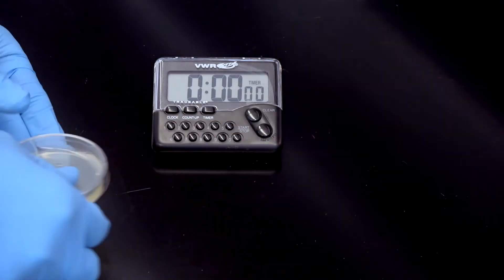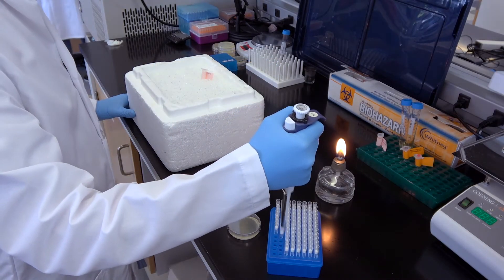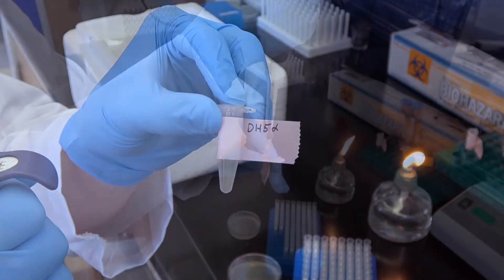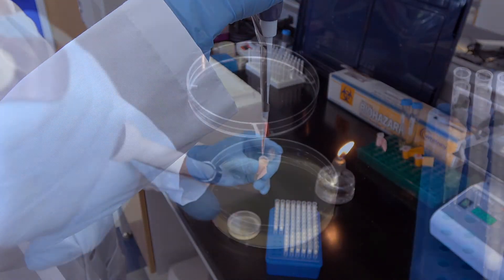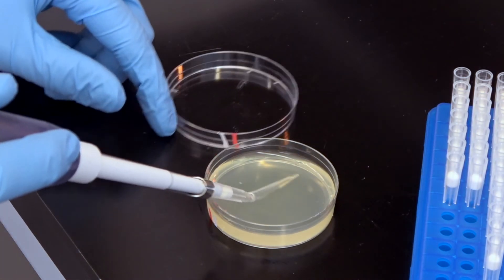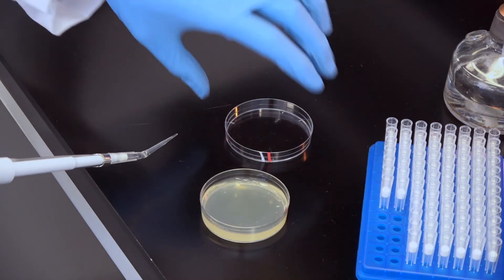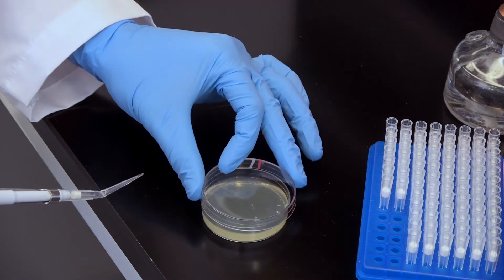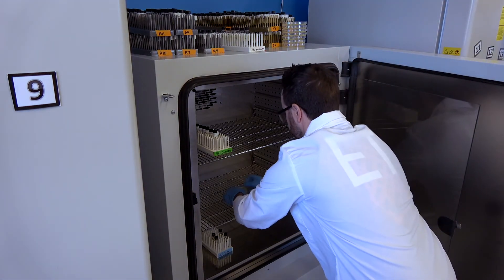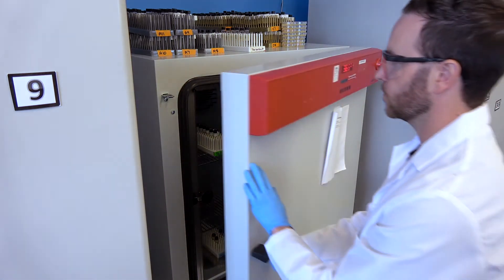When 30 minutes is up, we're ready to spread the bacteria onto the plate. We use the same technique we used to spread the antibiotic — we plate 50 microliters of the transformed E. coli, bend our pipette tip, and spread the E. coli over the entire surface of the plate using the bent tip, being careful not to dig into the plate. Now we place the plate at 37 degrees Celsius for 18 hours to allow the antibiotic-resistant E. coli to grow.